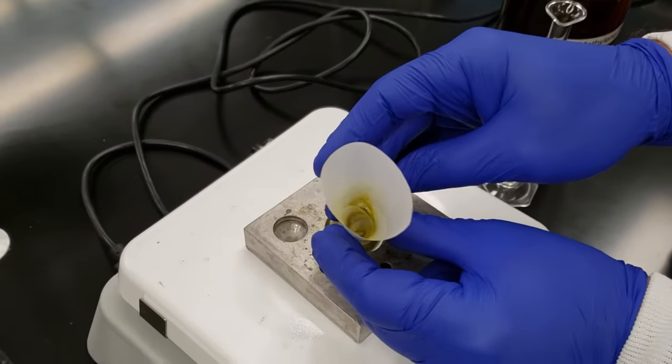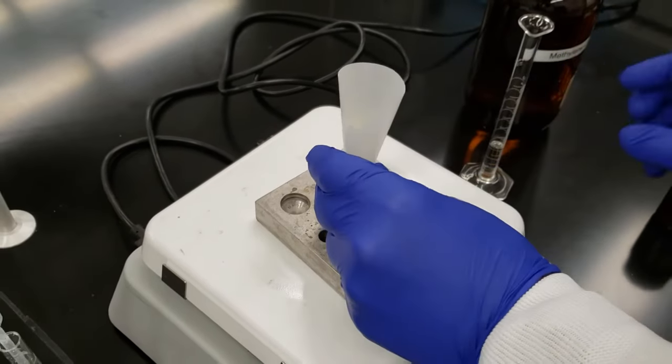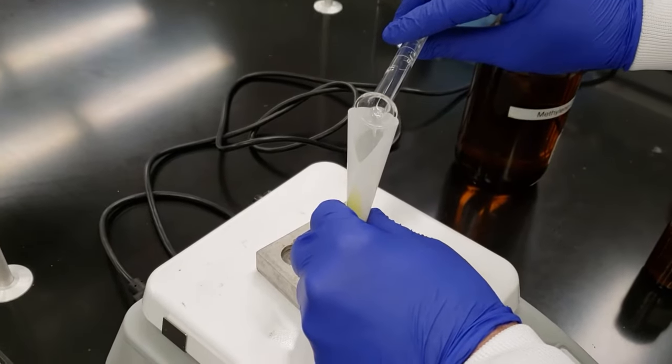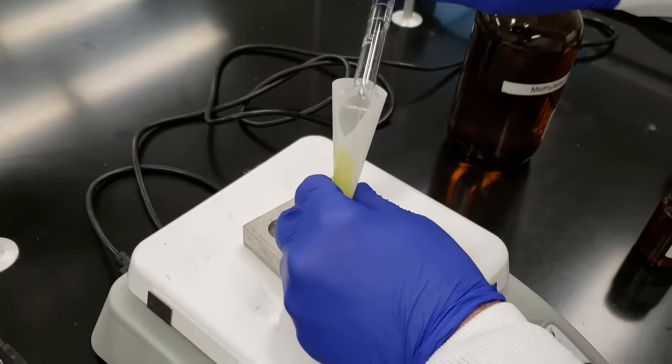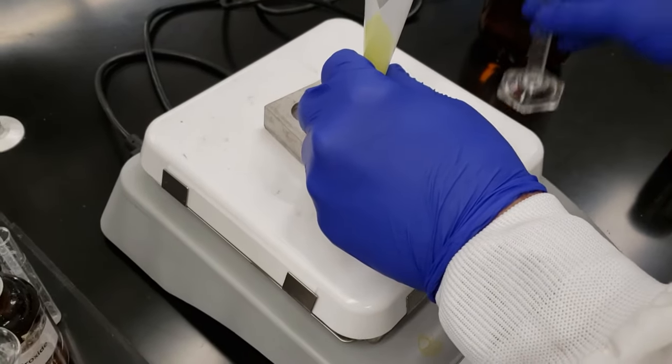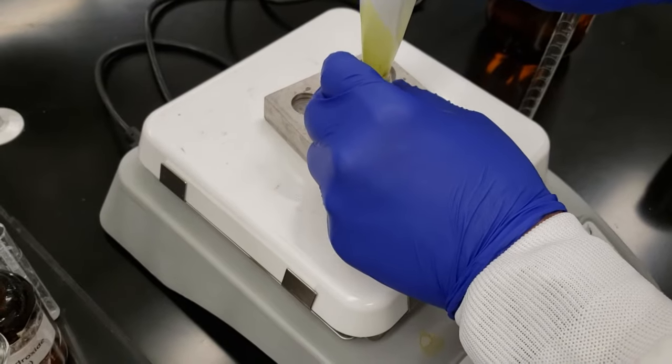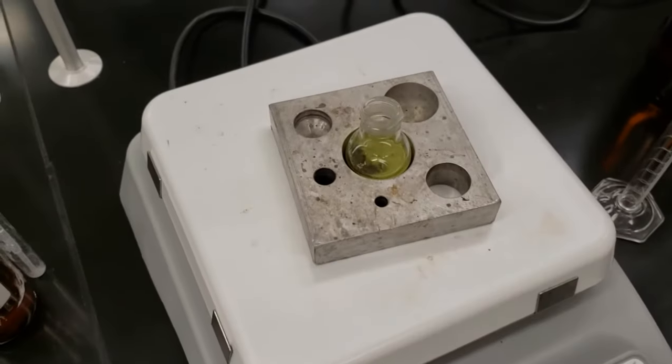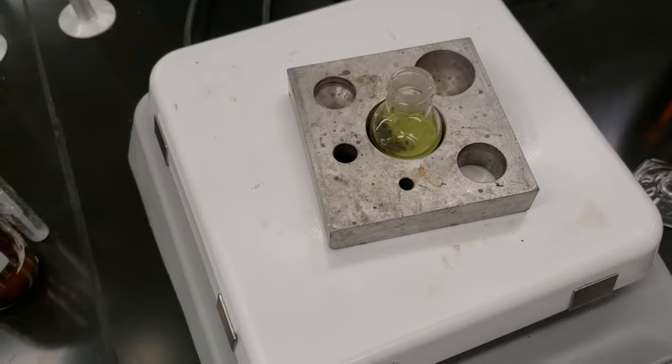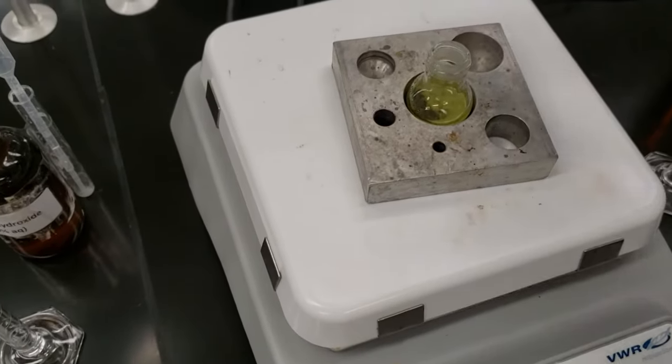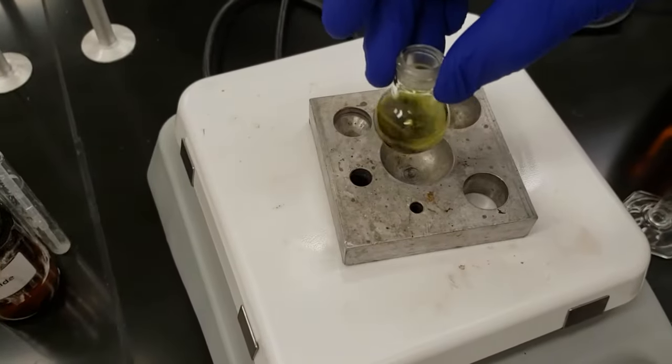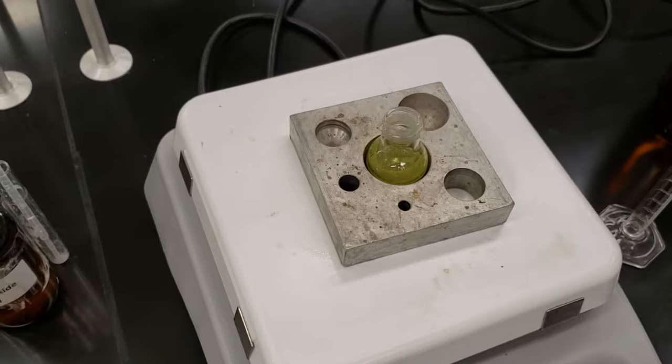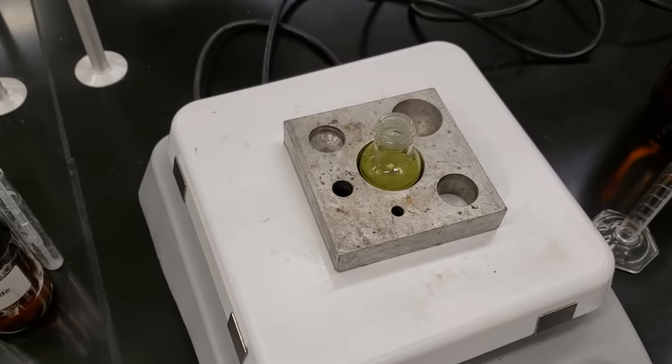And I'm going to pour my methylene chloride in through my funnel here. You can probably see that we've got some solids stuck in there. We'll go ahead and rinse it down using our methylene chloride. We'll put our spin vane in, set it in the center of our stir plate, and we'll start it stirring ever so slowly here.